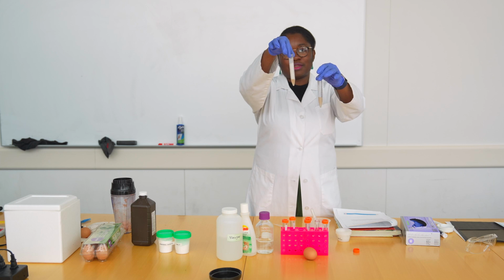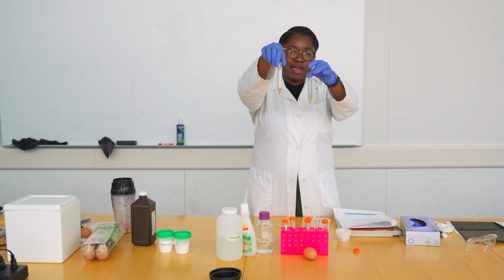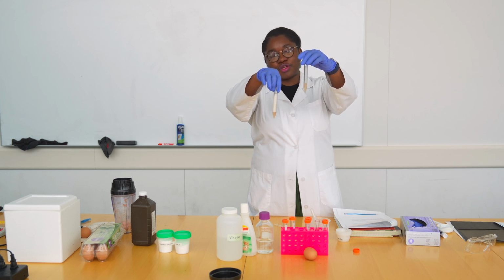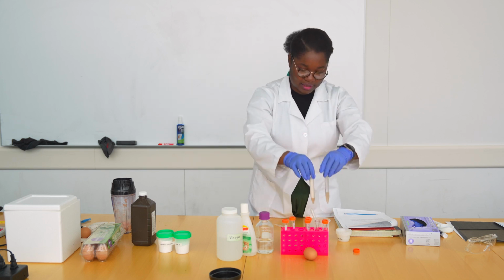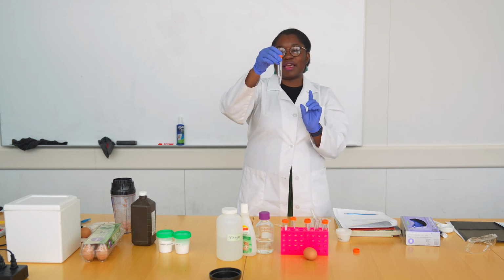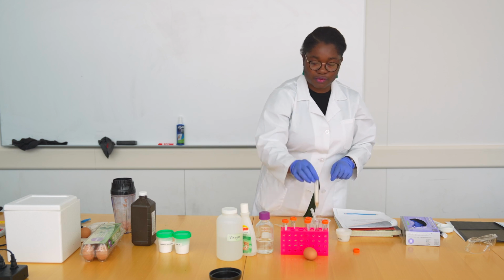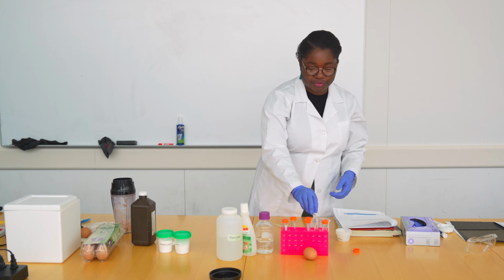In the tube that only has the potato juice and the hydrogen peroxide, our foam is quite tall. But in this tube that has the vinegar, in addition to the potato juice and the hydrogen peroxide, we don't see anything. In our water control, where we wanted to see if the hydrogen peroxide and the vinegar are reacting, we also don't see anything. So here it can be quite safe to assume that vinegar is preventing the reaction from happening.